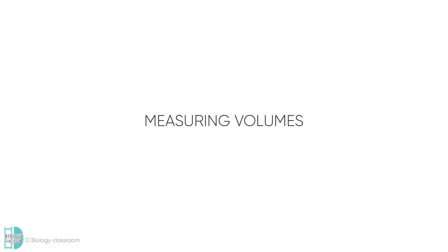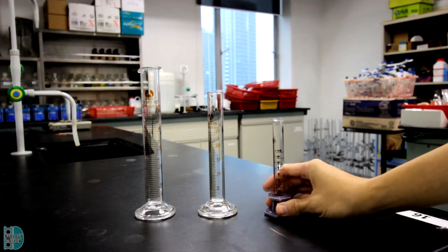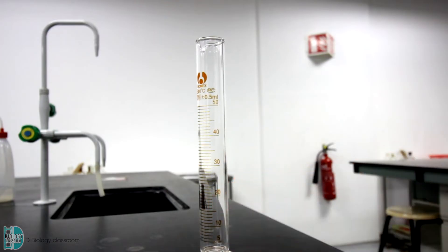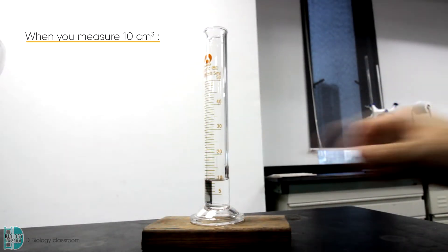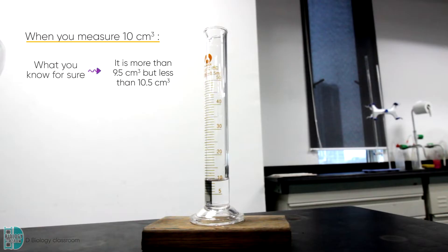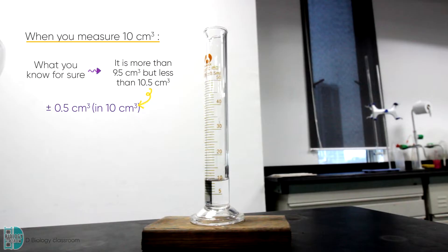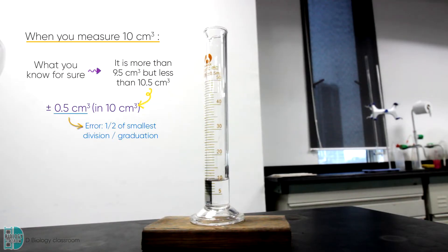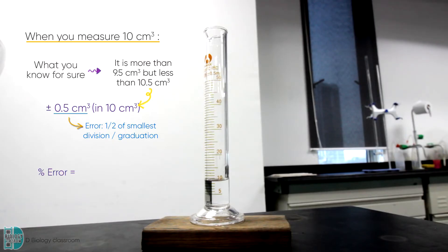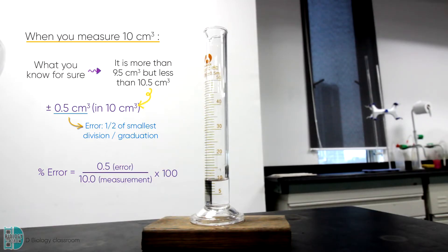You can measure the volume of a liquid with a measuring cylinder, pipette or burette. Measuring cylinders are the least accurate of the three. A cylinder usually has graduations every 1 cm³. When you measure 10 cm³, you can be sure that you have more than 9.5 cm³ but less than 10.5 cm³. In this case, your error is plus minus 0.5 cm³ in 10 cm³, which is plus minus half of the smallest division. The percentage error in this case would be 0.5 divided by 10 times 100, which is 5%.